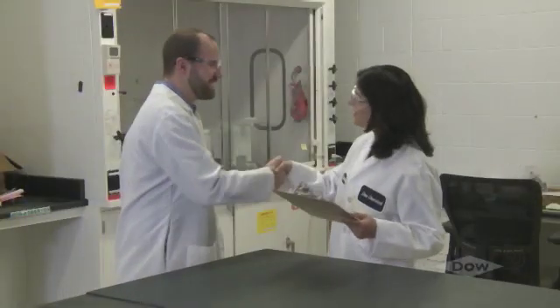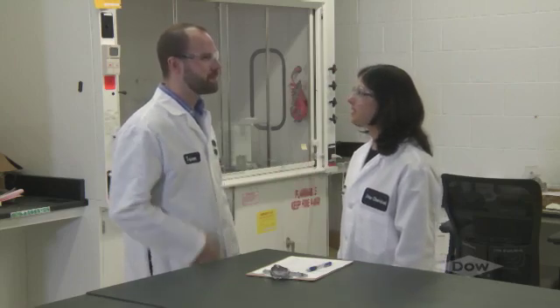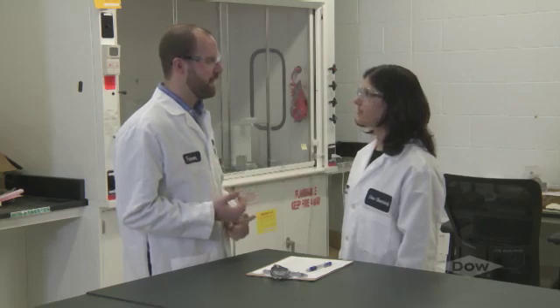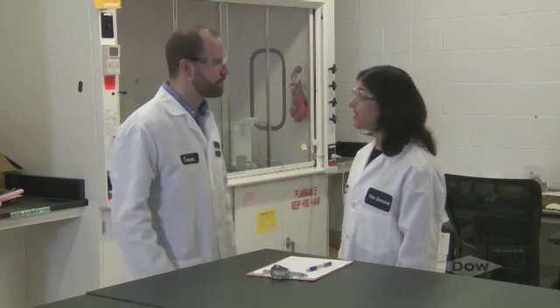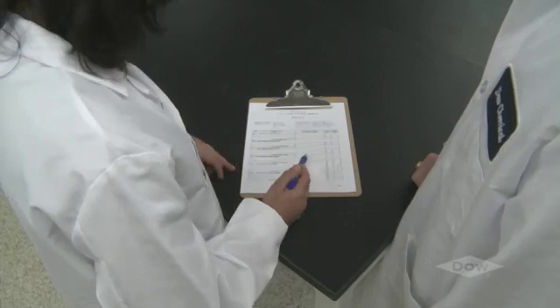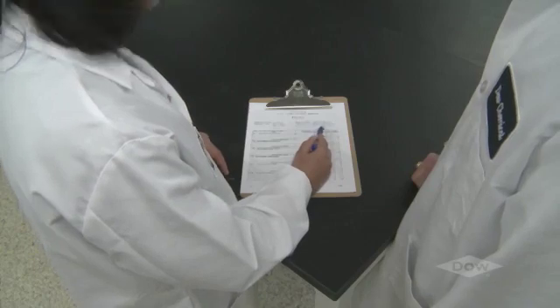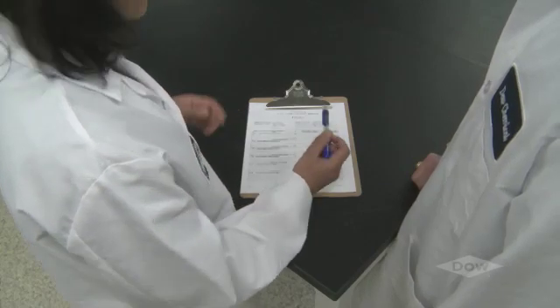Let's follow Amaruka and Trevor as they go through their lab's inspection procedure, which includes the components of an effective program. At first glance, you might think Amaruka and Trevor are just talking. But in fact, they are using an important and powerful component of the inspection procedure. Make a personal connection during the inspection. Inspections are more than checking off items on a checklist to see what's good or bad. They are an opportunity to ensure everyone in the lab clearly recognizes and understands what's needed to maximize lab safety.